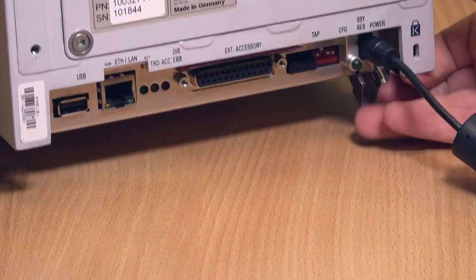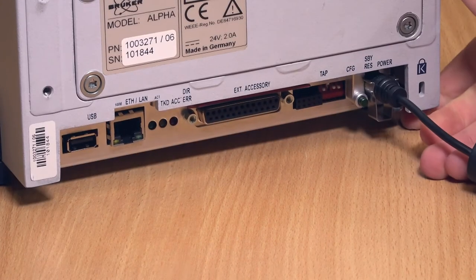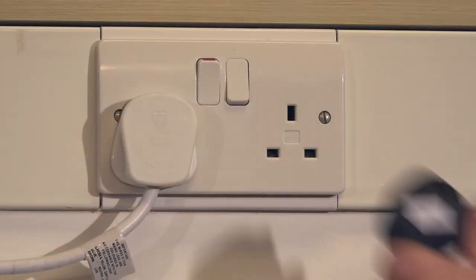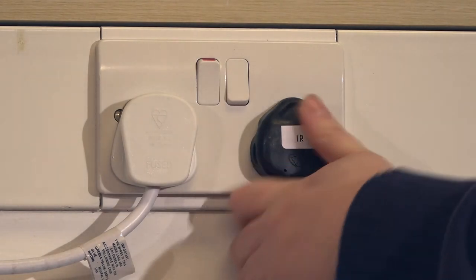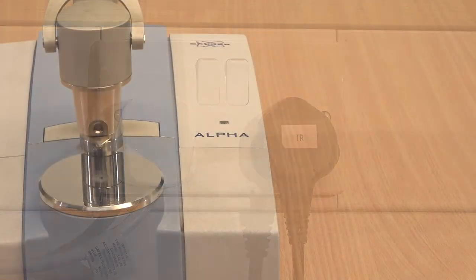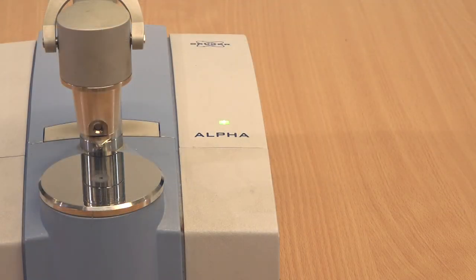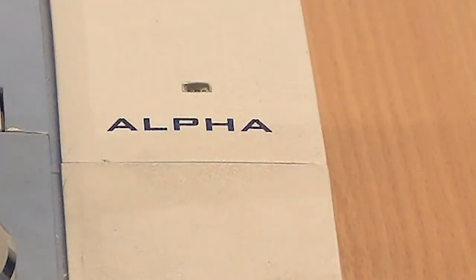This stops it being pulled out during operation. There is no on-off switch on the spectrometer, so switch it on at the wall socket. A light will come on on the spectrometer. If it is green, it's operating correctly. An amber light indicates that the humidity is not absolutely correct, but the IR spectrometer can still be used.